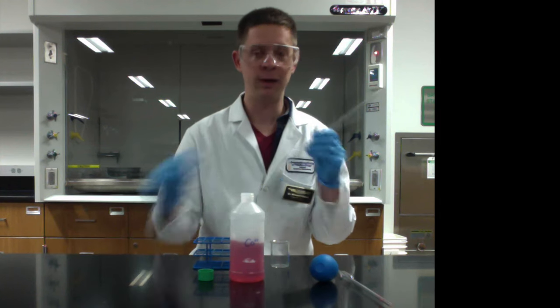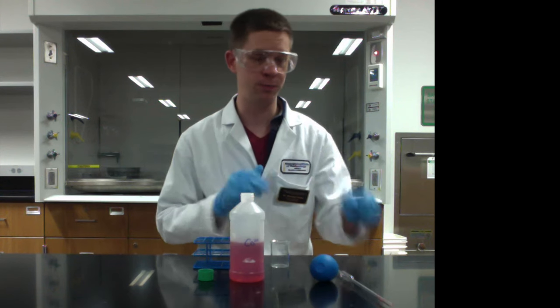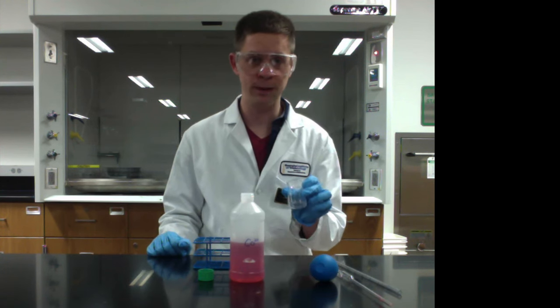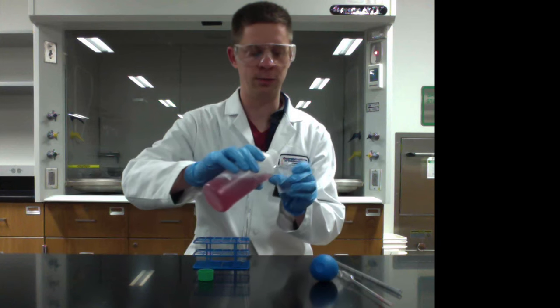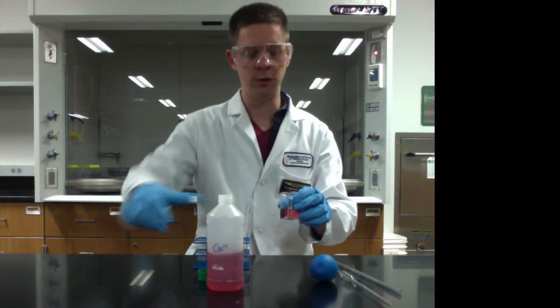The reason for that is there might be some contaminants on the pipette that you do not want going in the reagent bottle, which is a communal holding device, if you will, for the entire lab section. So you don't want to contaminate that. So bring a beaker with you to the hood or wherever the reagent bottle is stored and just pour out a little bit of liquid that you can use to pipette.